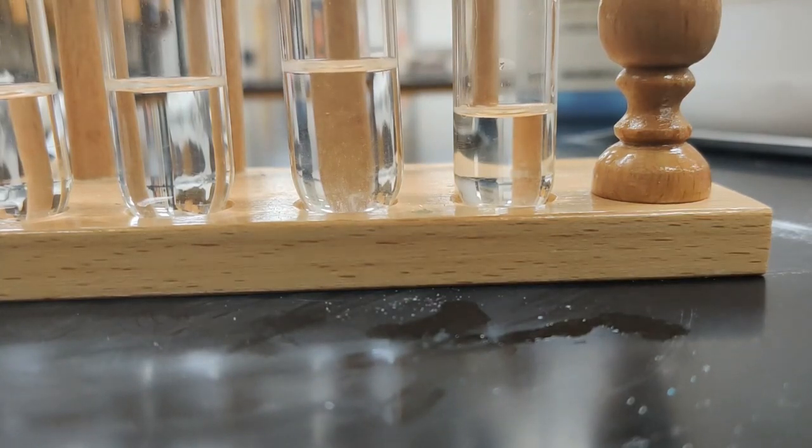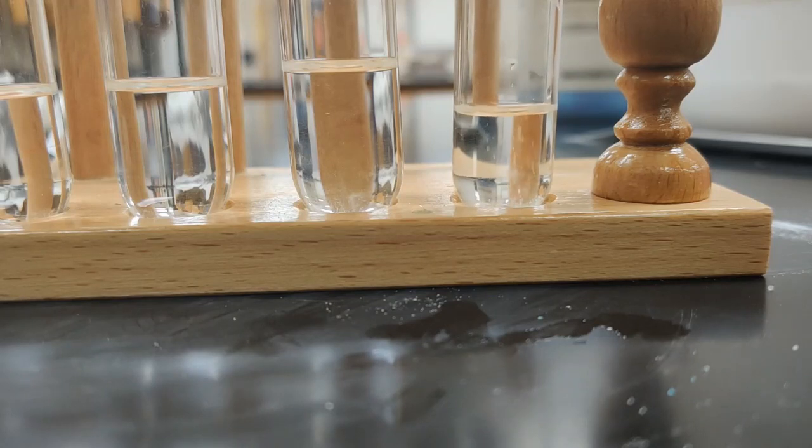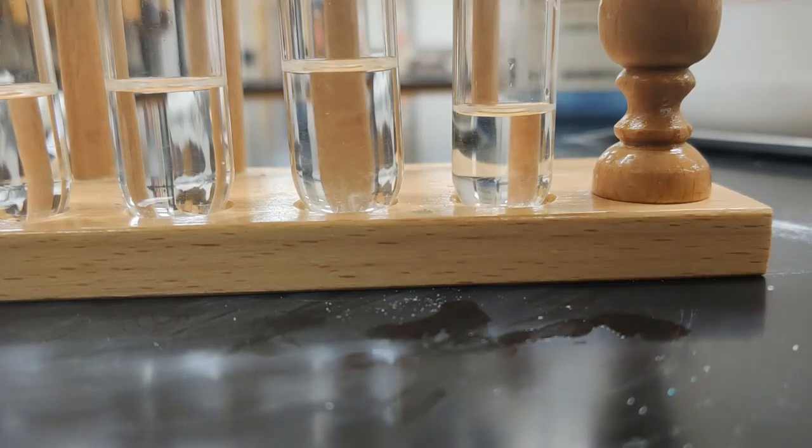And our last one is our good buddy sodium chloride. So we'll test that out. Well, if I can get it to stay on my scoop. So we'll put a little in there and see where we get. Put the lid back on the sodium chloride so it doesn't get spilled.